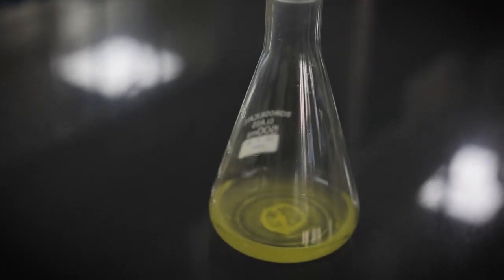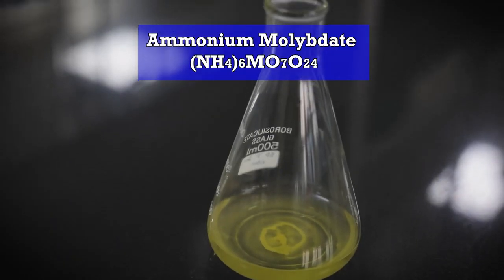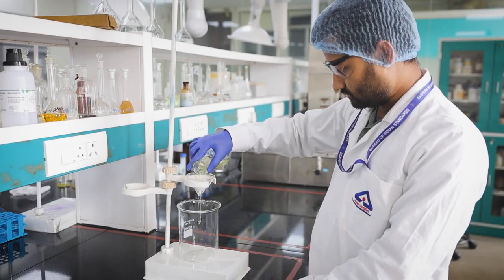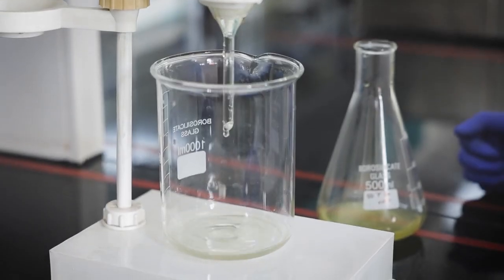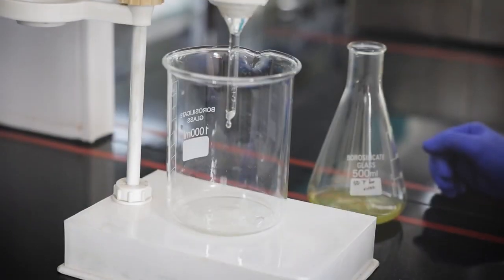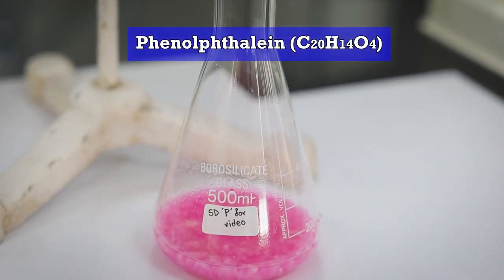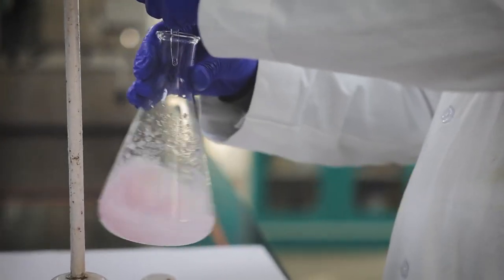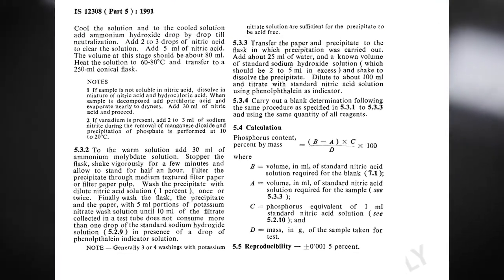Phosphorus is precipitated as ammonium phosphomolybdate by introducing ammonium molybdate into the solution, isolating the phosphorus in a quantifiable form. The precipitate is subsequently filtered, thoroughly washed to remove residual impurities, and dissolved in sodium hydroxide. The resulting solution is then titrated with nitric acid using phenolphthalein as an indicator, with the endpoint marked by the disappearance of the pink color. Finally, the phosphorus content is calculated based on the recorded titration volumes.